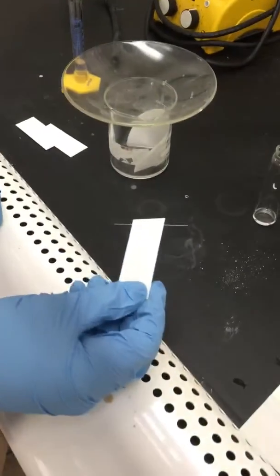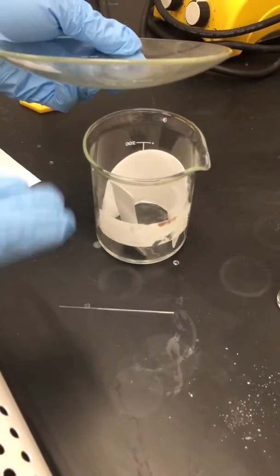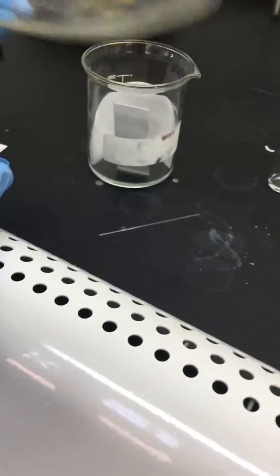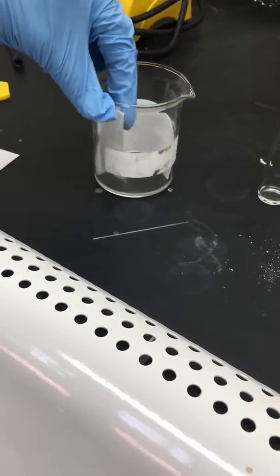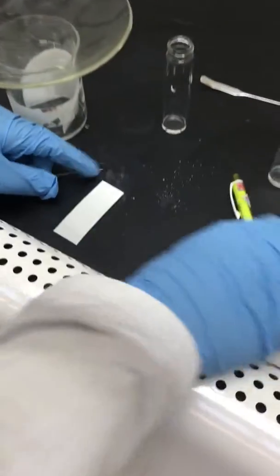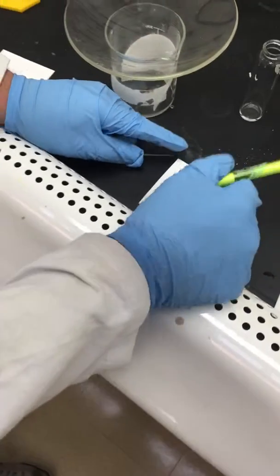Once the materials on the TLC strip have dried, we place them in the developing chamber, and then we wait. It's important that the solvent starts below the line so that it doesn't run off. And now we wait for it to develop and run up the TLC strip using capillary action. So now we can see that the solvent is close to the top of the TLC strip. So we'll remove the strip from the developing chamber, and at the solvent line, we will draw a line with the pencil to mark the solvent line.